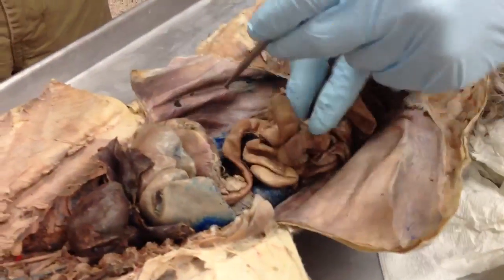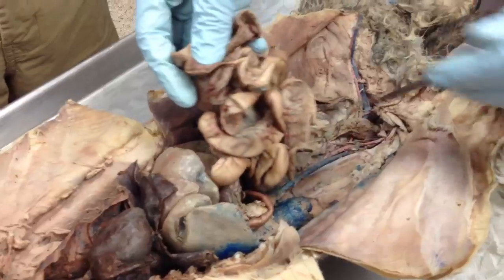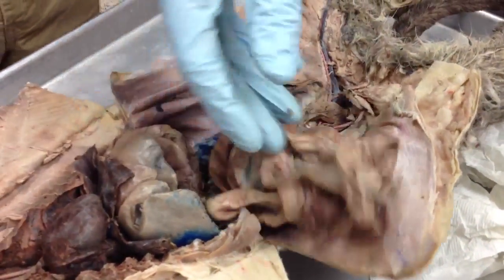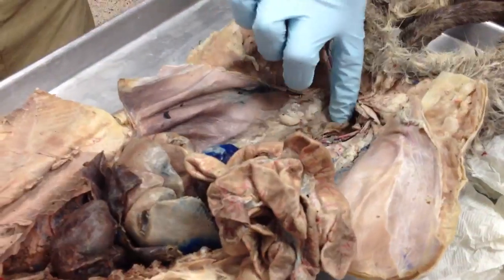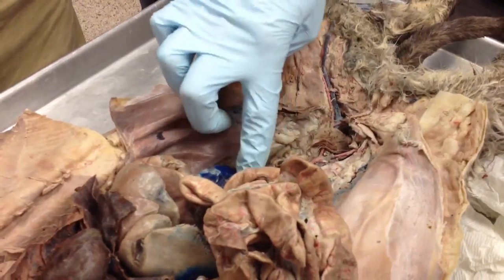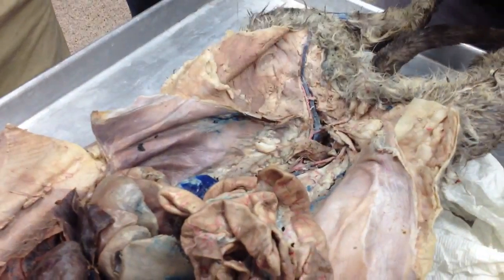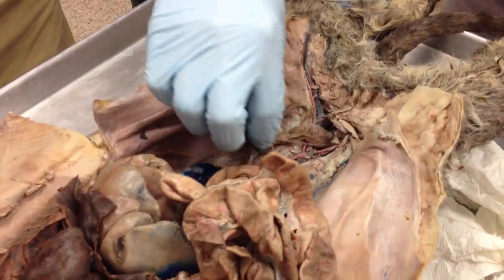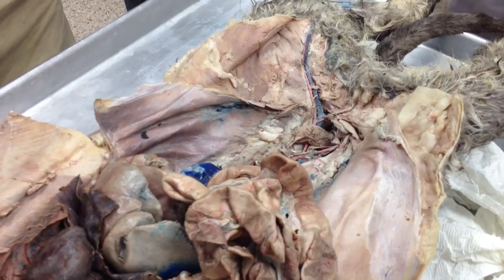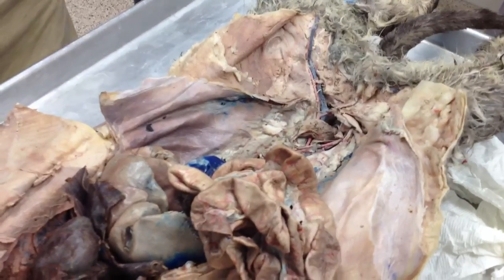Goes up, ascending, transverse colon, and descending. But if I have any of that pinned and you just answer colon, that's fine with me. I'm not going to have you answer anything beyond that. And that empties into your rectum eventually. So colon, large intestine, then your rectum in this area. So that's it. There's only eight things, I think, for identification.